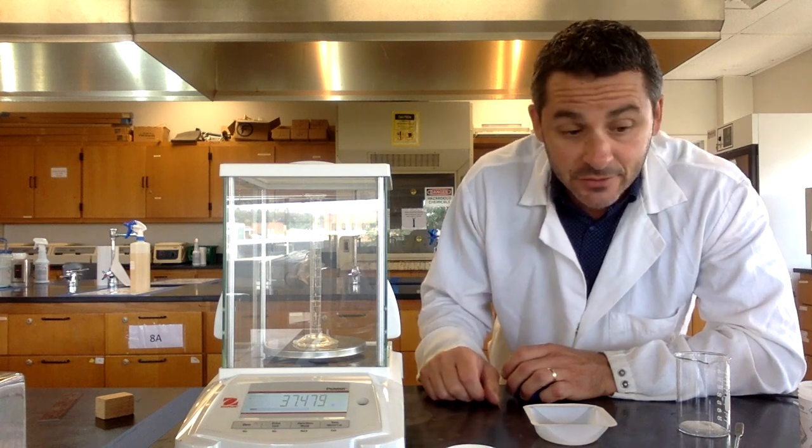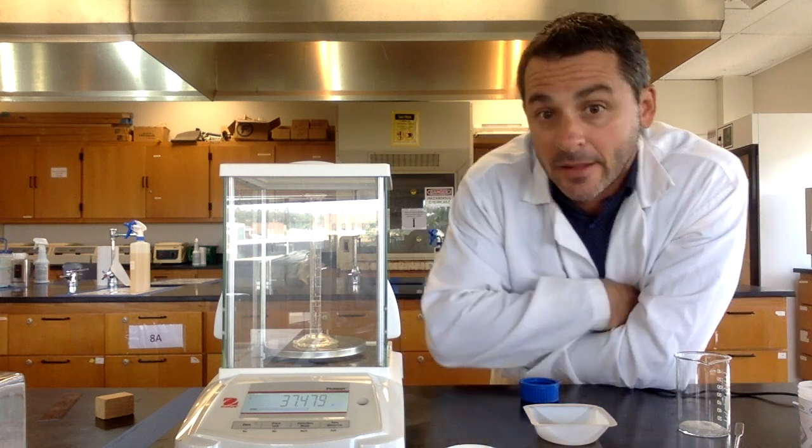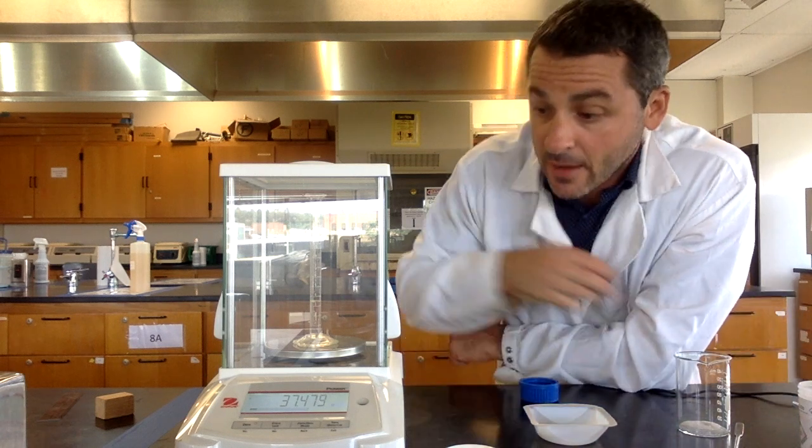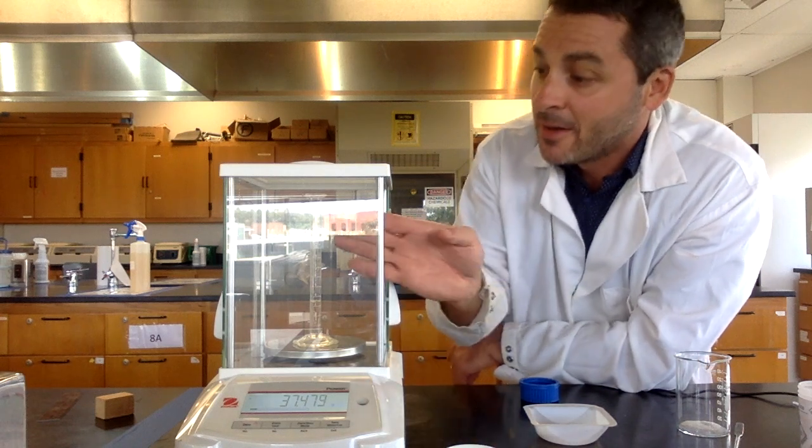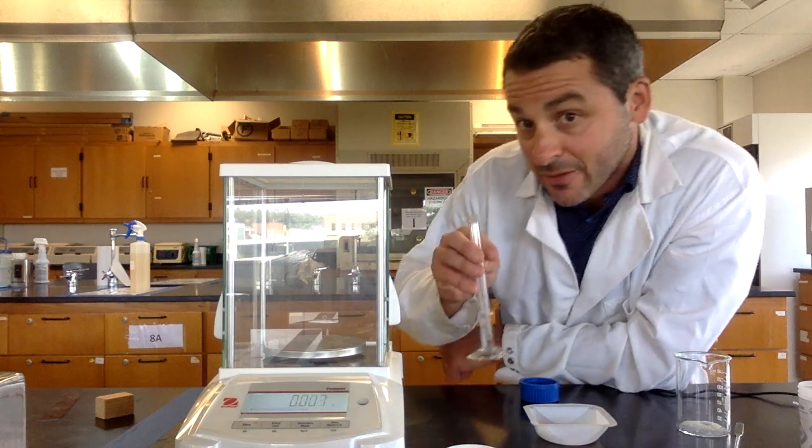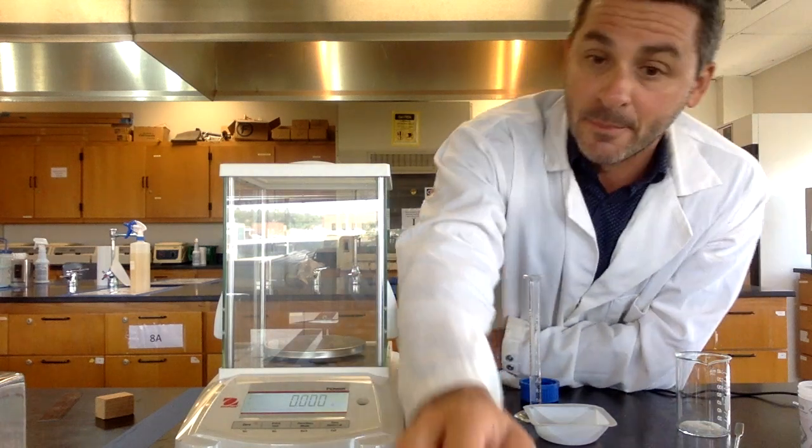That is the proper balance usage. Remember, you're always writing down all of the digits on the balance. Don't add stuff while it's on the balance because it's easier to clean up spills on the bench rather than in the balance. And that is balance usage.